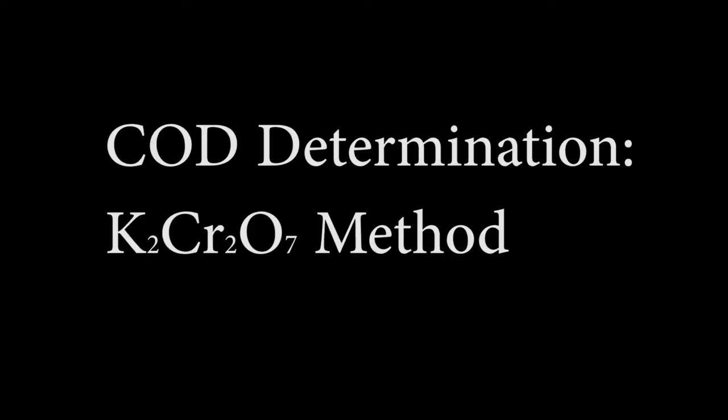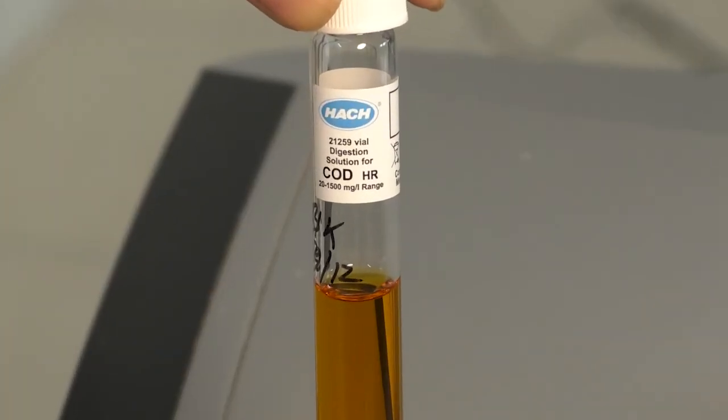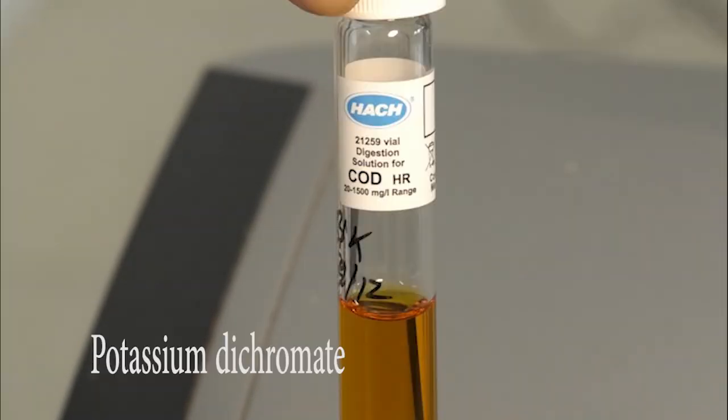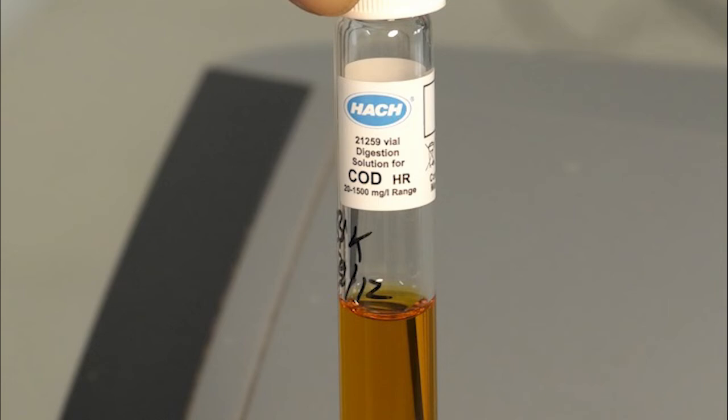Now we will show you the COD determination using potassium dichromate. For this method we have a standard vial where standard solution of potassium dichromate is already in there. We will add a sample of 2 ml into the vial. If the concentration of COD is high, then we will first dilute the sample. Additionally, we will also add 2 ml of dilution water into another vial, which will act as blank.